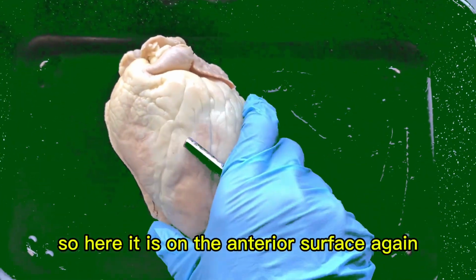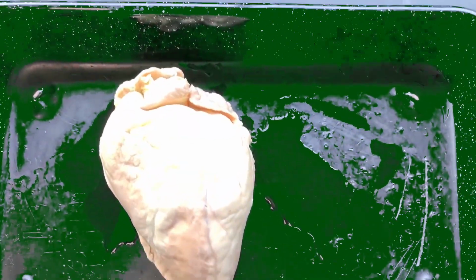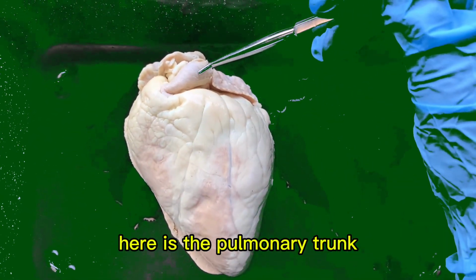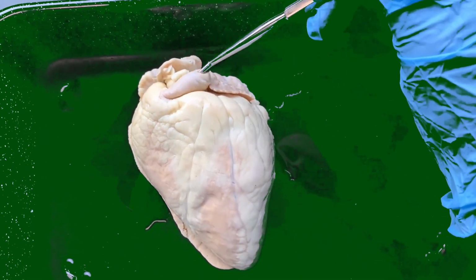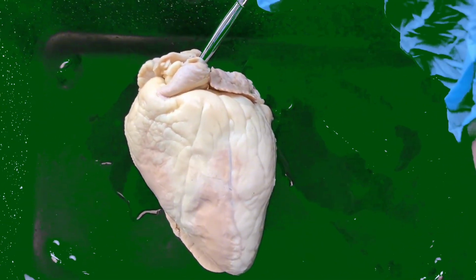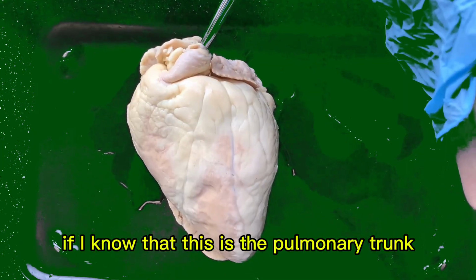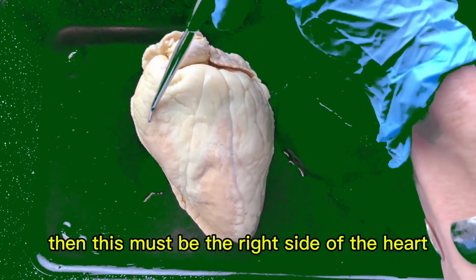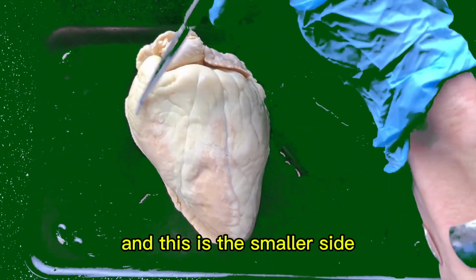So here it is on the anterior surface again. Here's the anterior of the heart. Here is the pulmonary trunk. If I know that this is the pulmonary trunk and the pulmonary trunk is on the right side of the heart, then this must be the right side of the heart, and this is the smaller side.